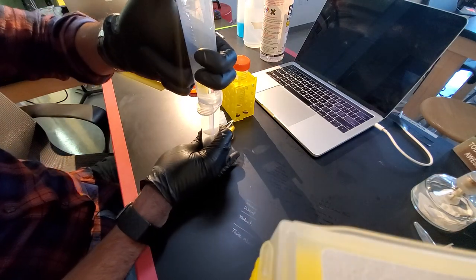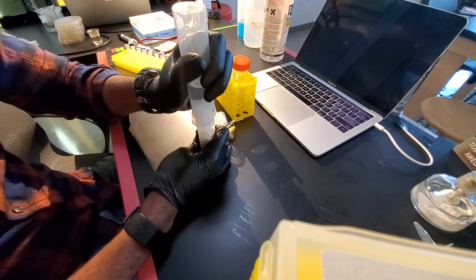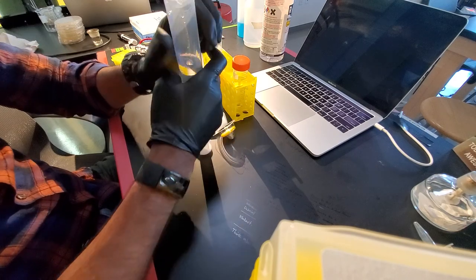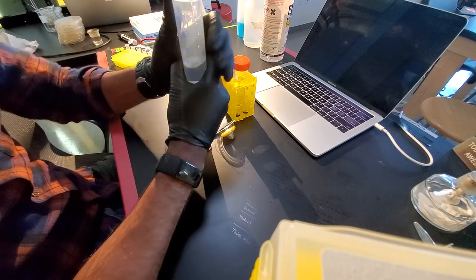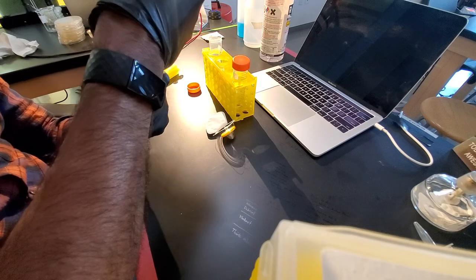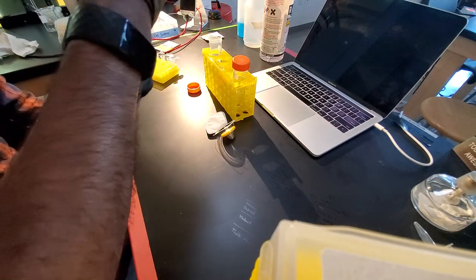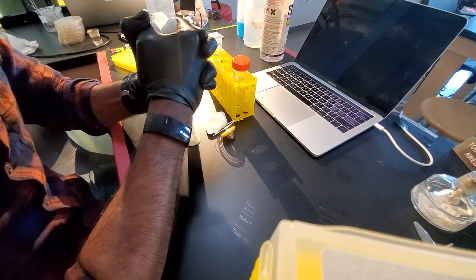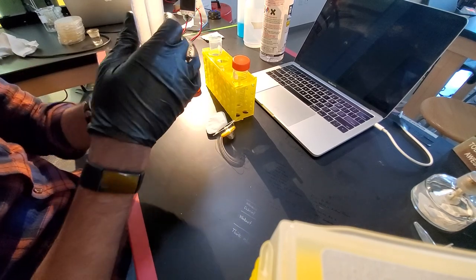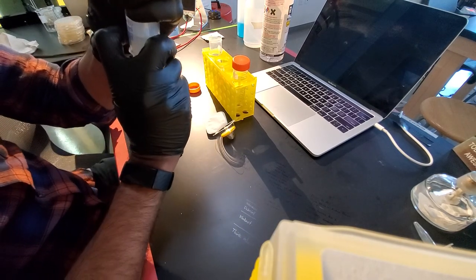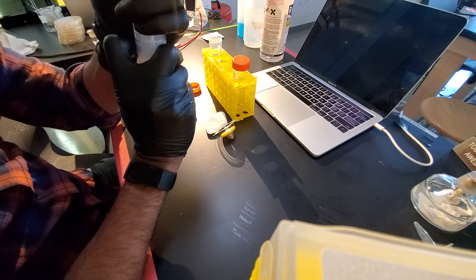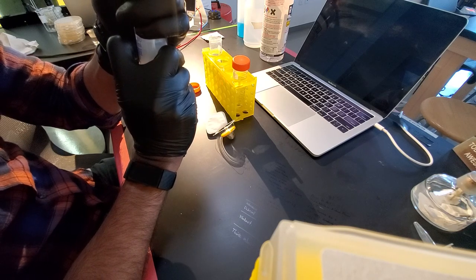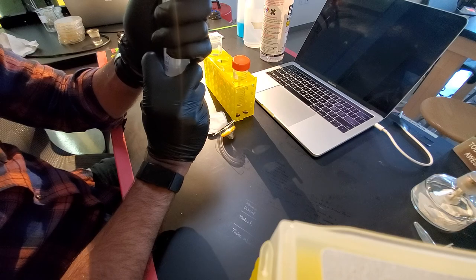And then I'm going to remove the air and push the syringe down and the volume of liquid up to the top of the syringe. I don't know why I'm having so much trouble with it right now. Okay.